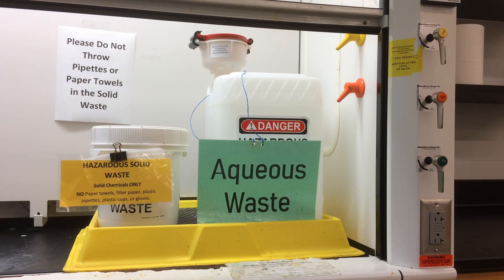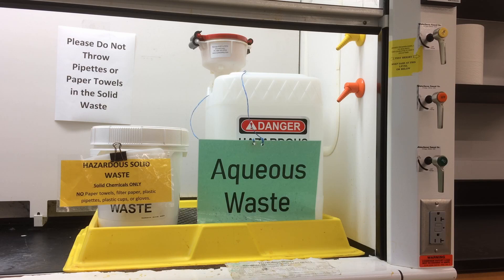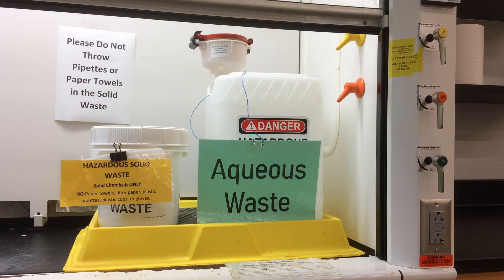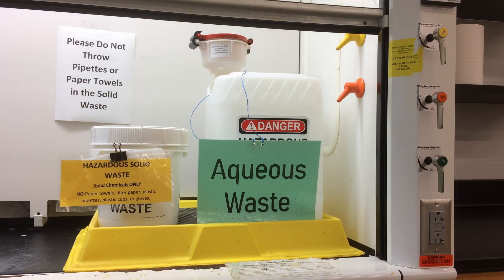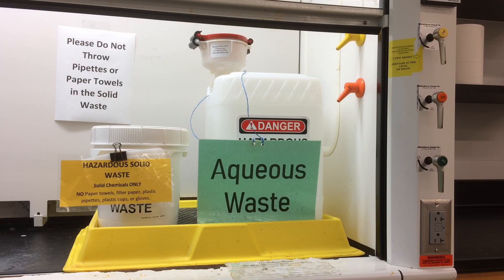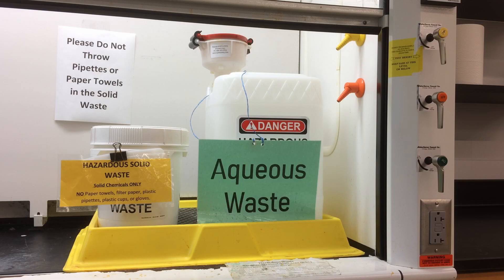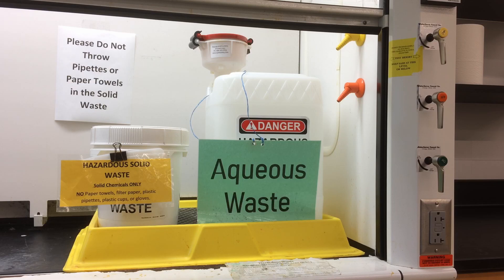Hi, today I'm going to talk about how we manage the chemical waste here in General Chemistry Lab at USF.